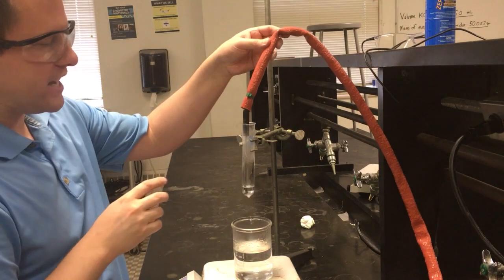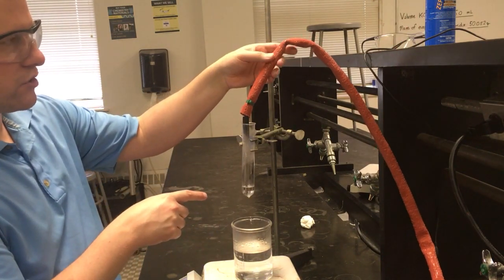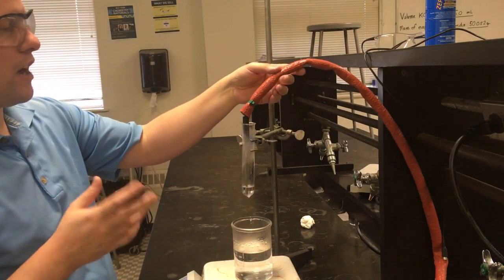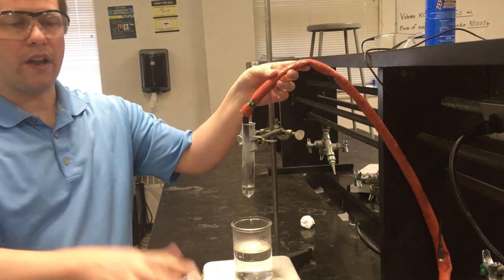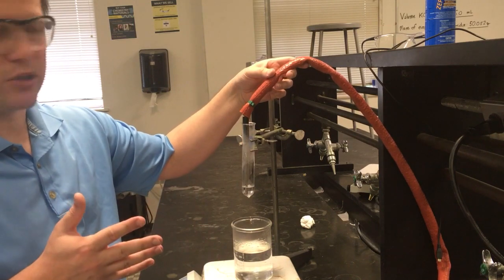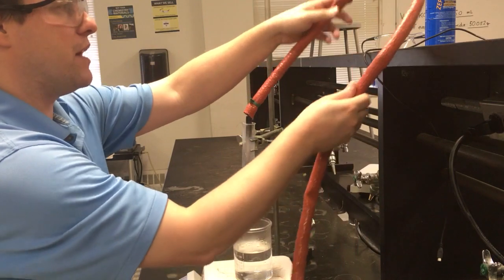And so I'm going to be looking in our solution for when we first get crystals to form. And not only when do we first get crystals to form, but also, if we're looking at our actual data down here, how does that compare to the freezing point temperatures that we're going to see? Because crystals are probably going to form before we actually are able to measure a freezing point.